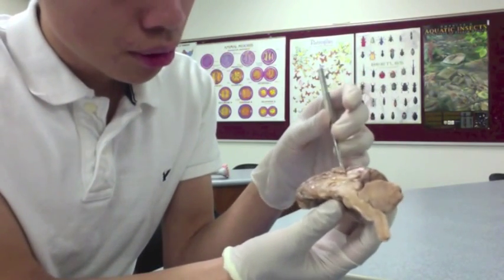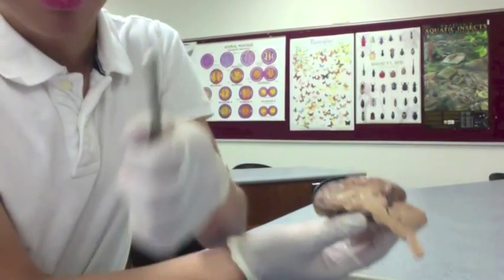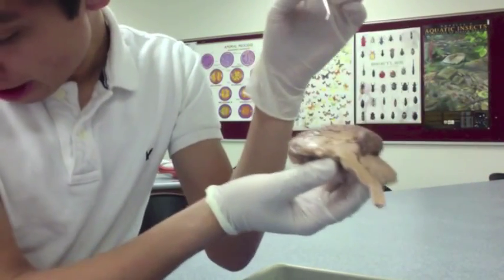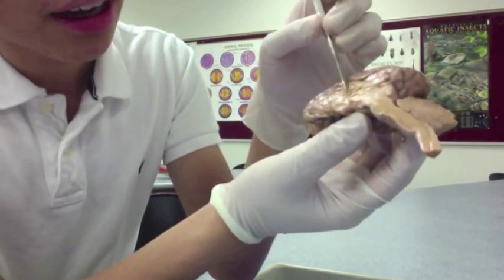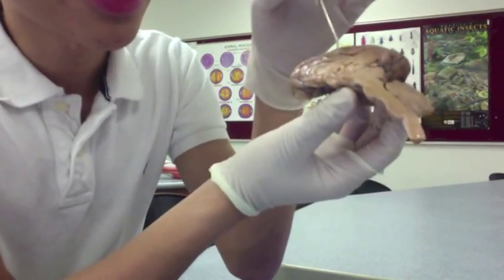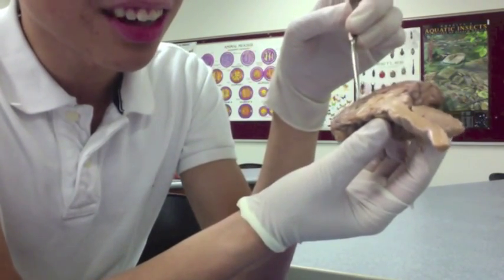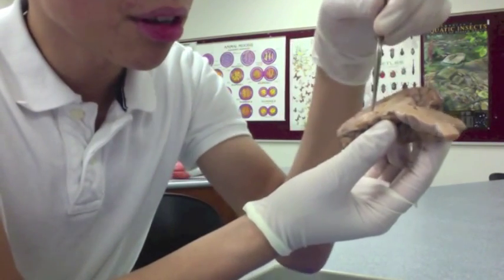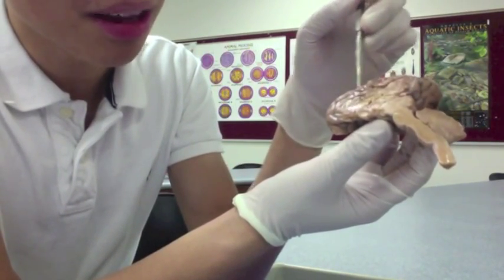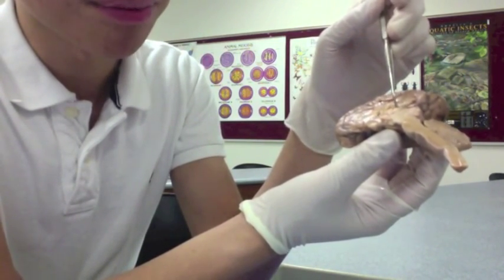You have the corpus callosum, which is the top line. You have the fornix, which is the bottom line, above your thalamus. There's actually a clear distinction — it's very similar to the model. So your corpus callosum is the top line, then you have the septum pellucidum in the middle, then you have the fornix, which is the bottom line above your thalamus.